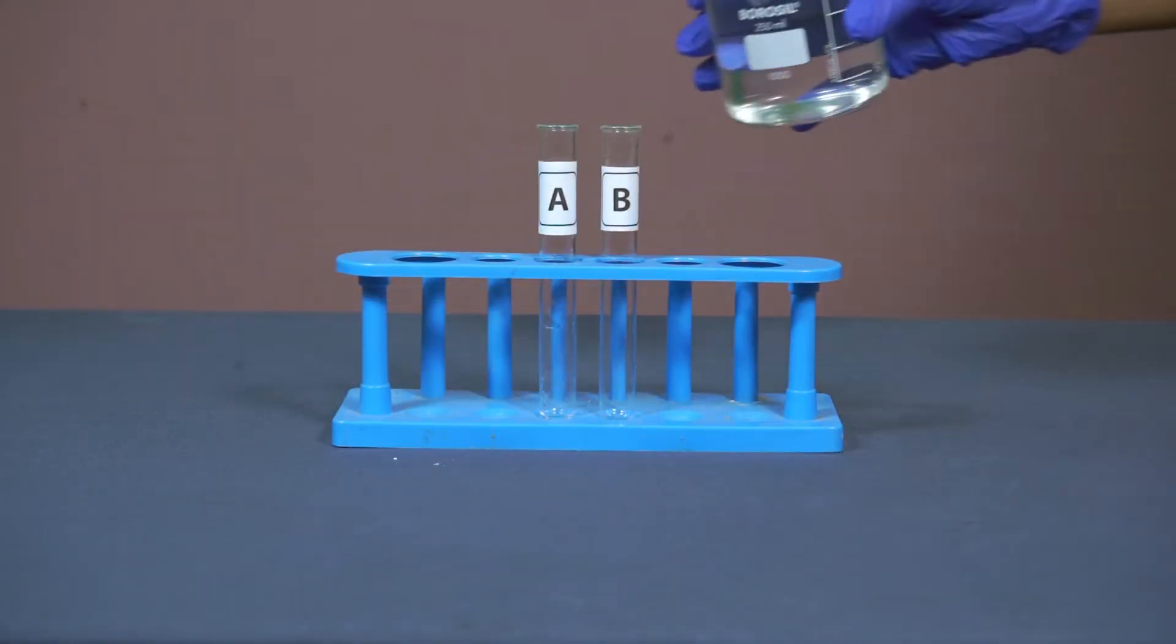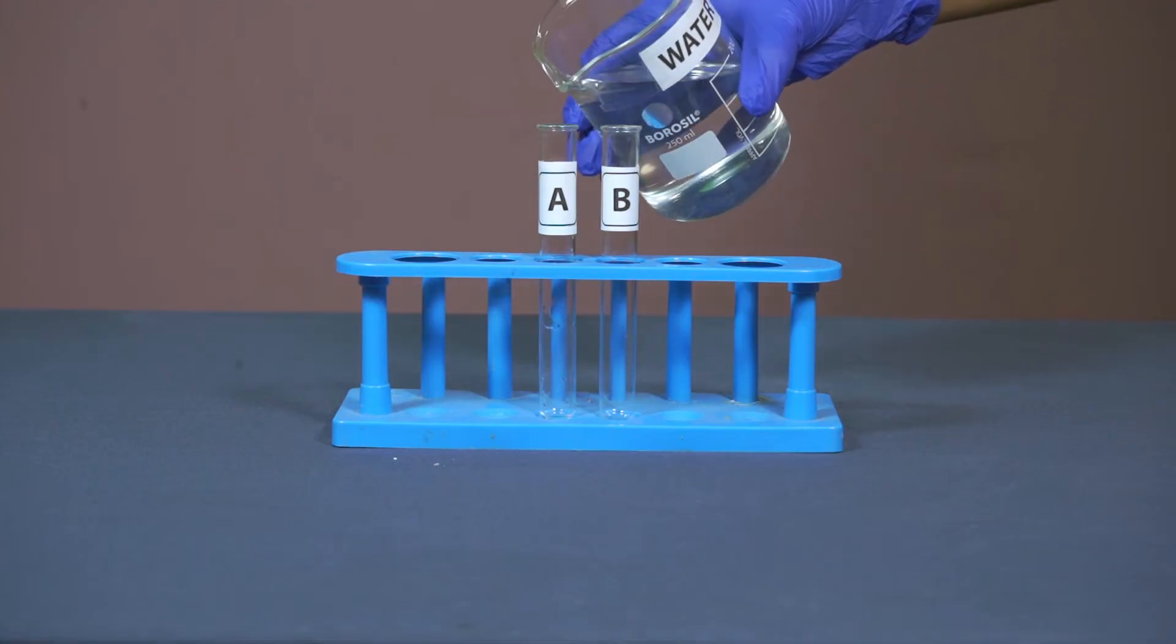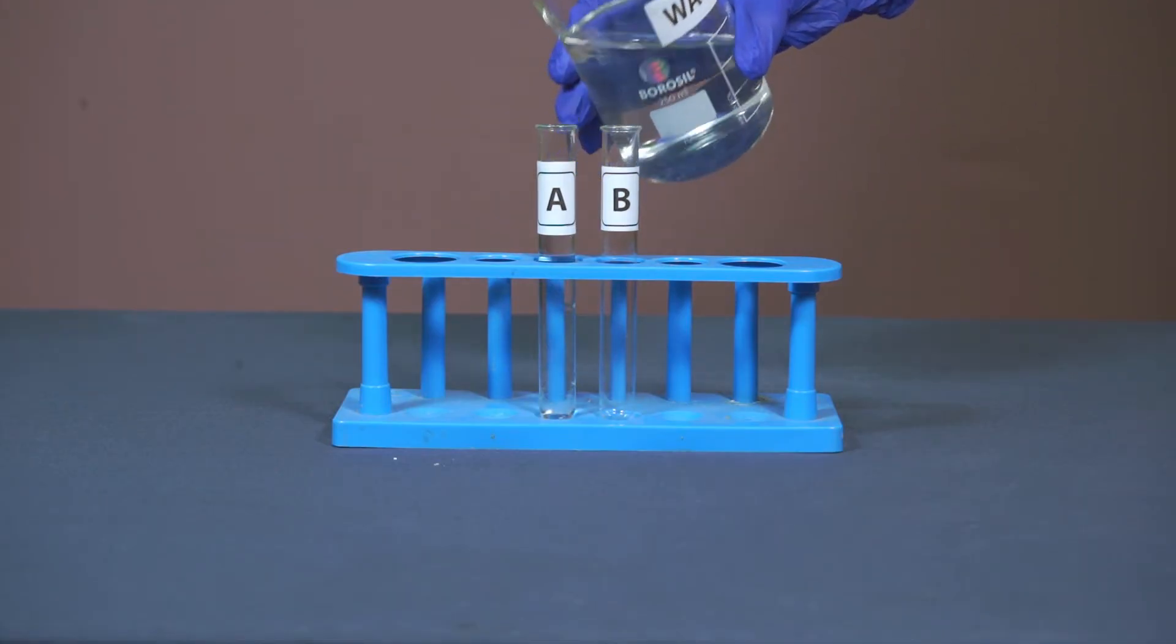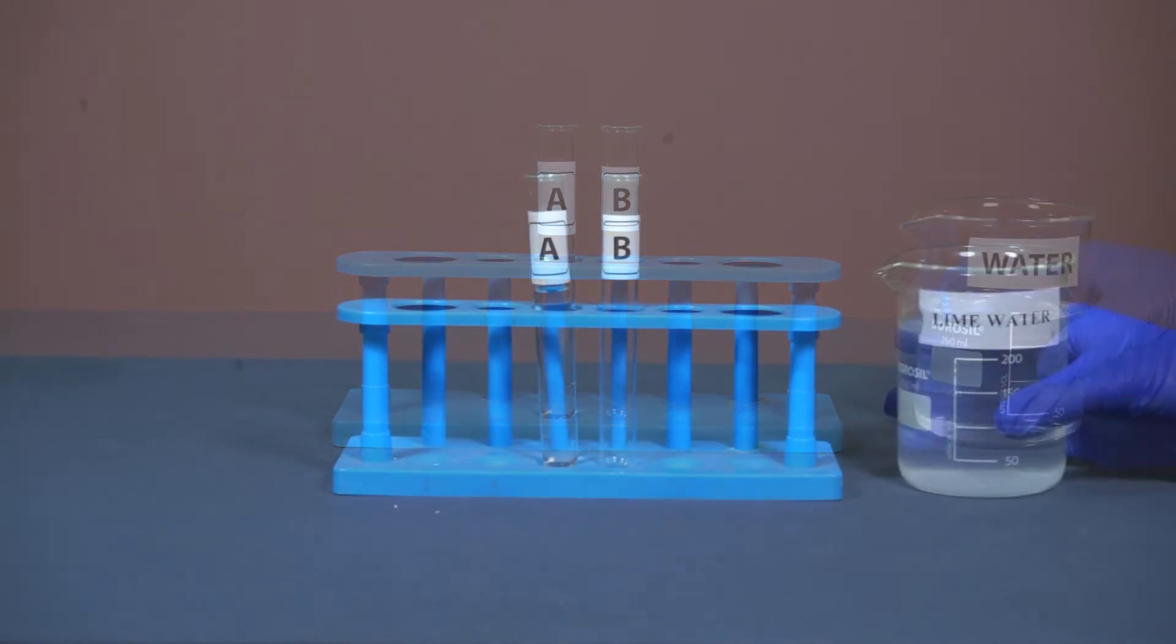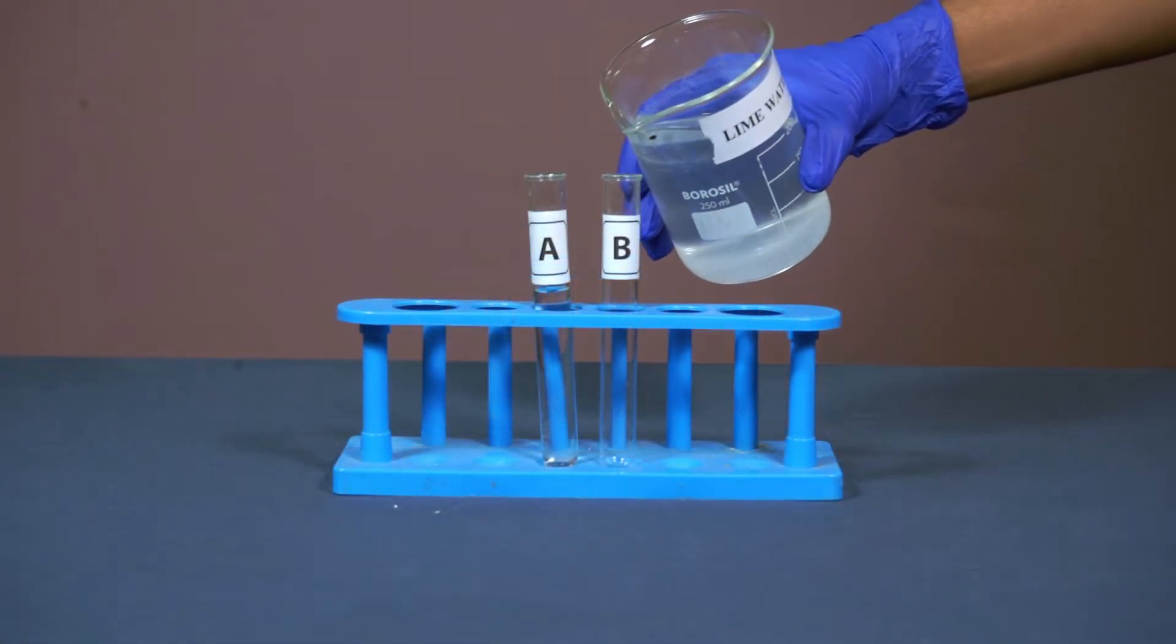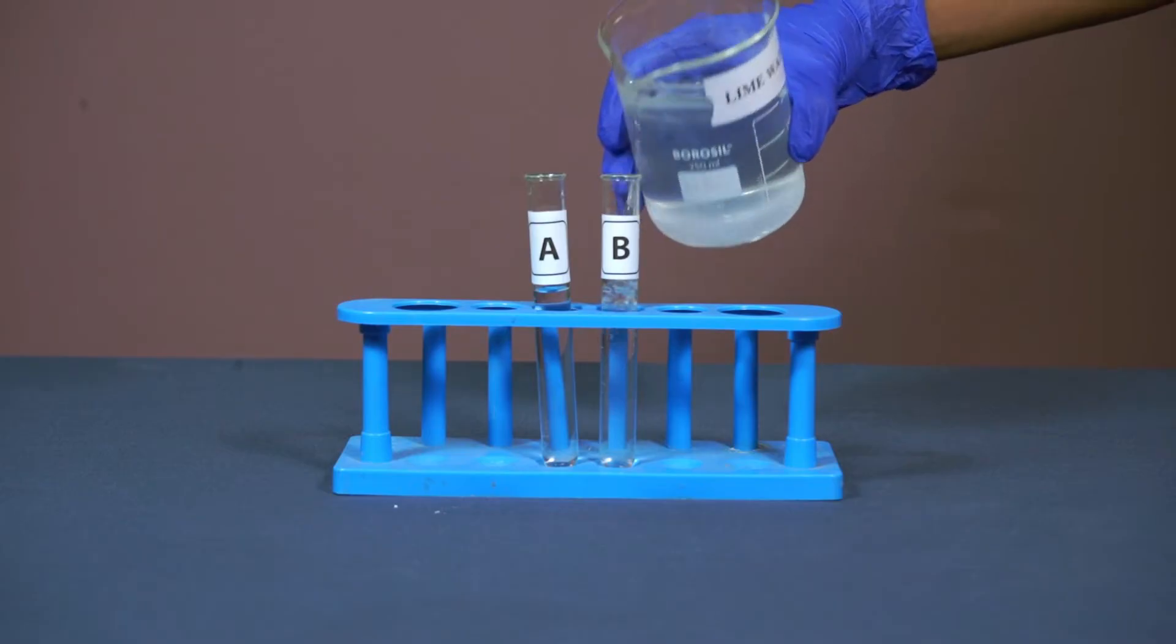Fill the test tube A with water. Take the same quantity of freshly prepared lime water in test tube B.